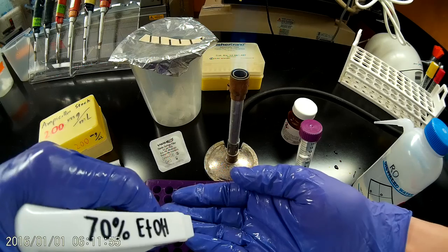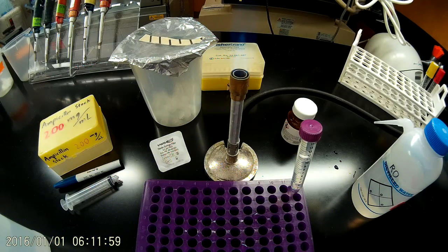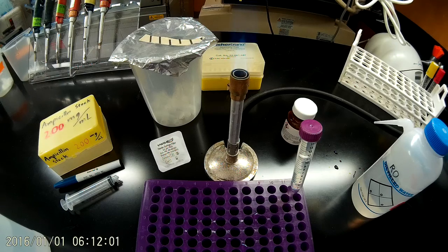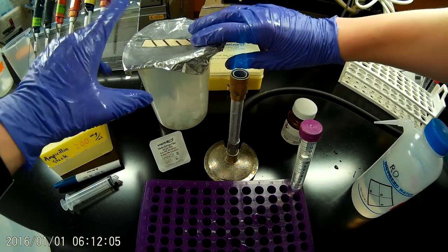I'm going to spray my hands with some 70% ethanol and I'll actually dry wash them. I'm going to do that back here because I'm about to put them into this beaker which has been autoclaved. That's sterile in there.